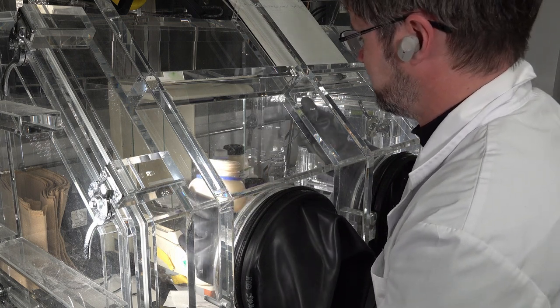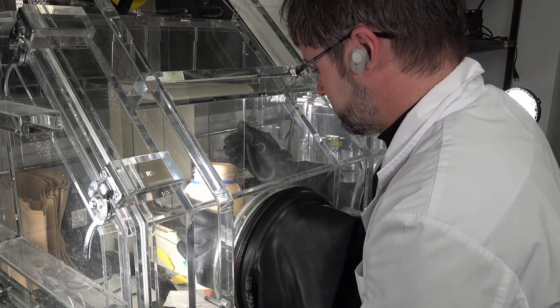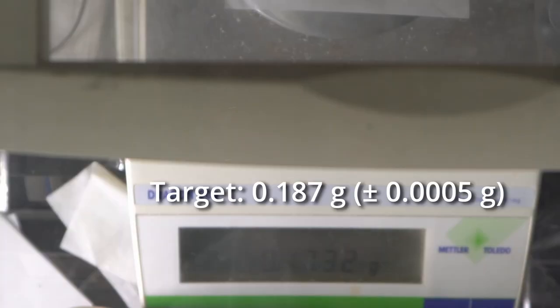Luckily didn't make a mess of it. Problem with glove boxes is they're very dry, which means there's a lot of static electricity and the powders literally jump off the spatula.